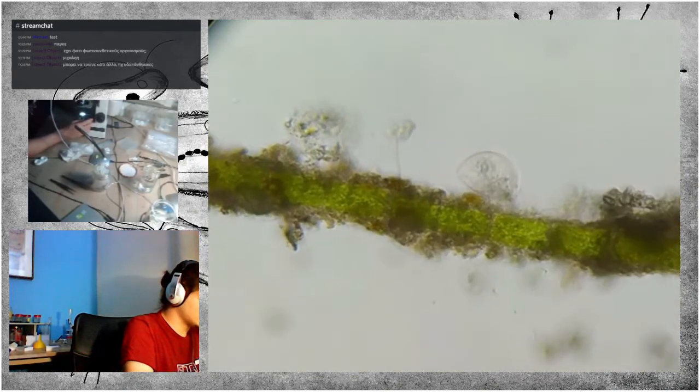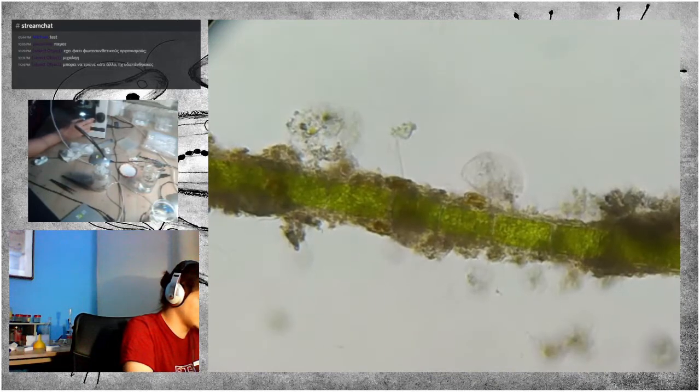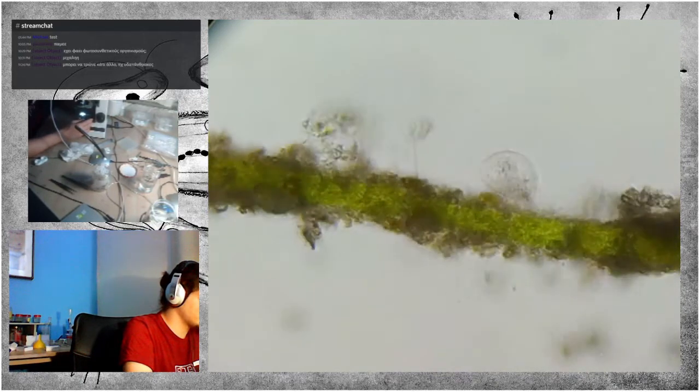I think this is the same species of ciliates we saw in the previous slide. So, yeah.